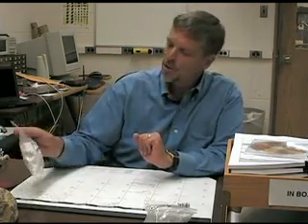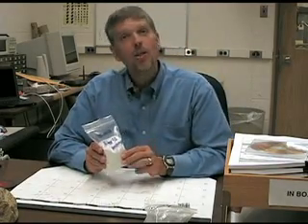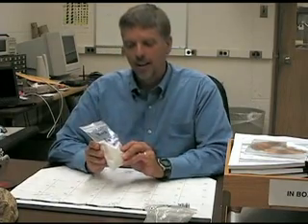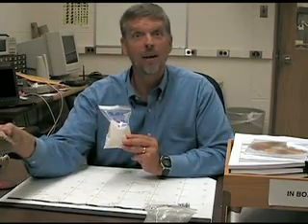Once we know this ratio, we can multiply it by the amount of Beryllium-9 we added to the sample, and that tells us how much Beryllium-10 is in every gram of this quartz. Once we know that, we can figure out how long this quartz was exposed to cosmic rays. And if I have done everything correctly, I can know how long ago the glacier retreated that left this boulder where I found it.